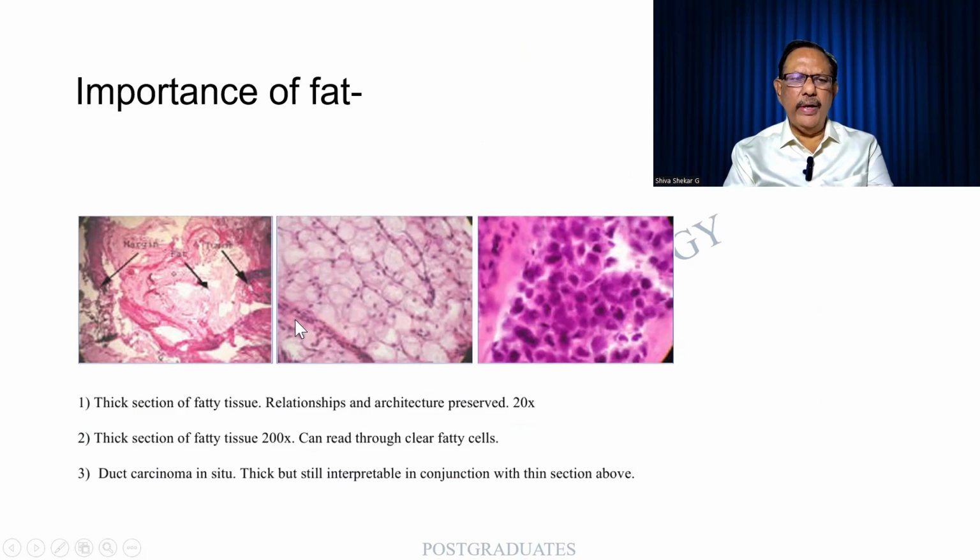The importance of fat. Here I find that there is too much artifactual change. This is the best of it. And in this, there is a tumor that has been identified.